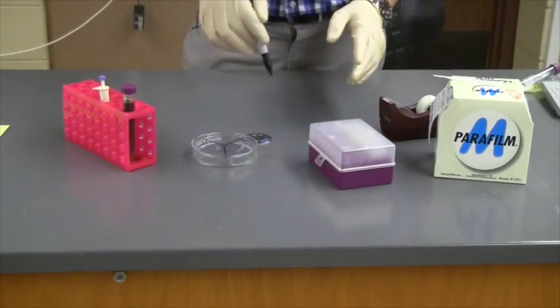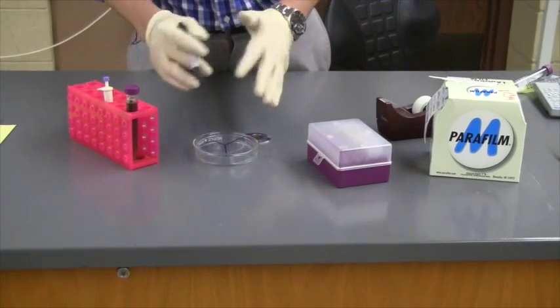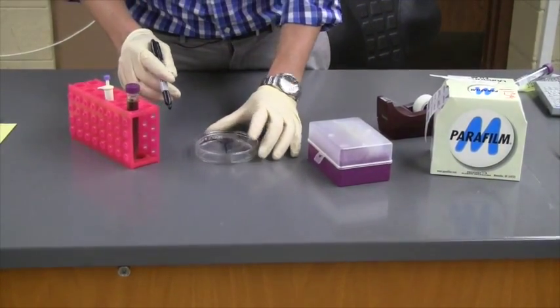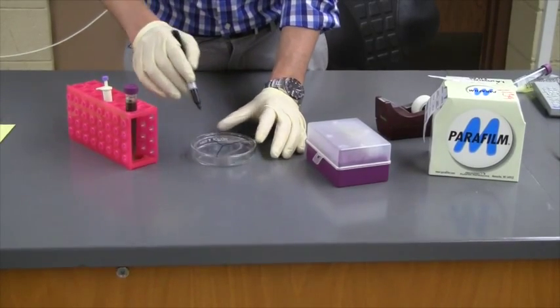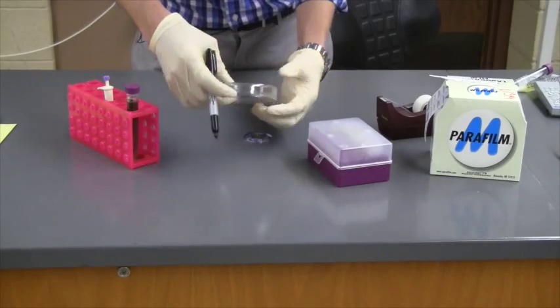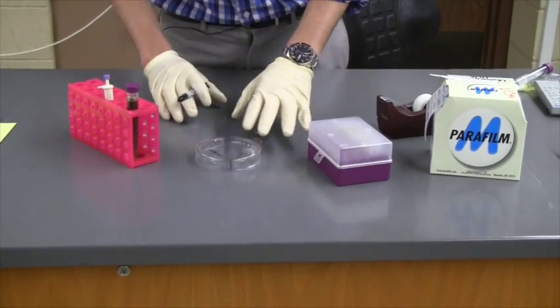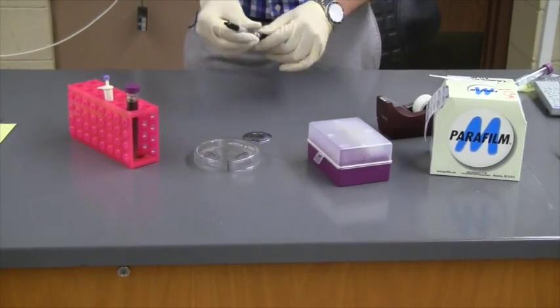You can divide it in half or quarters or thirds, whatever is appropriate for your experiment. Then you may want to label which side or which area is which on the bottom. That way when you look at it from the top, you can see what your treatments are.